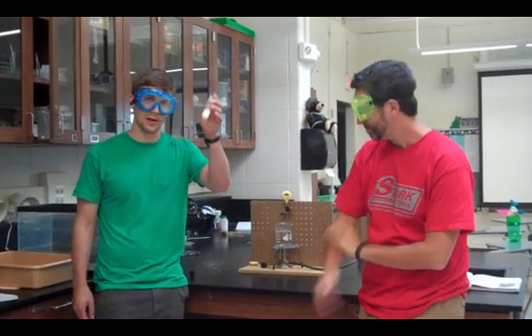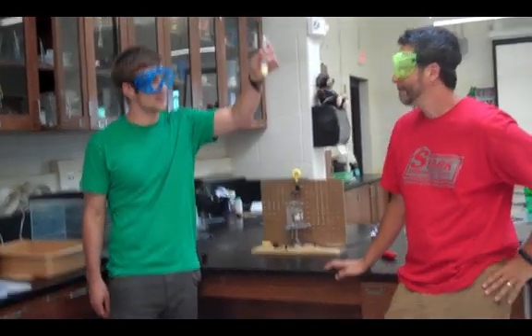Hey guys, it's Mr. Smyne and Mr. Cooper. Today we're going to find the melting point of this substance in this test tube.